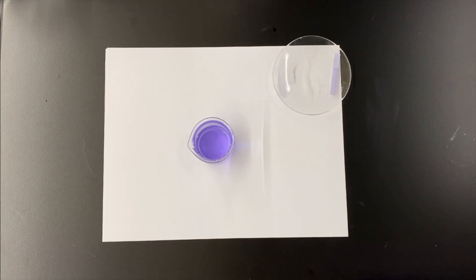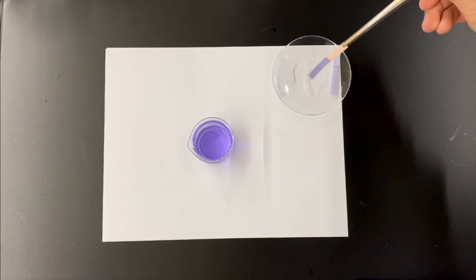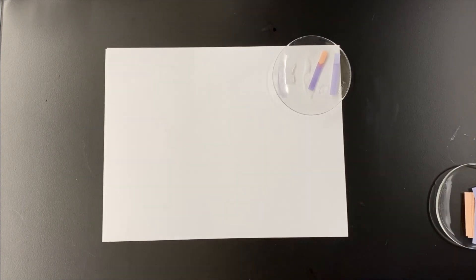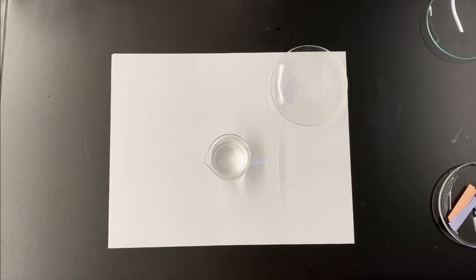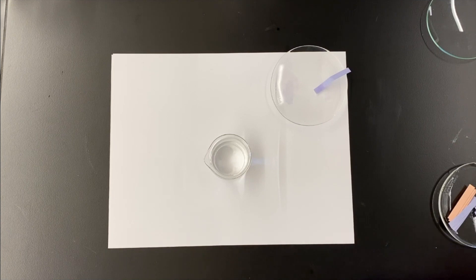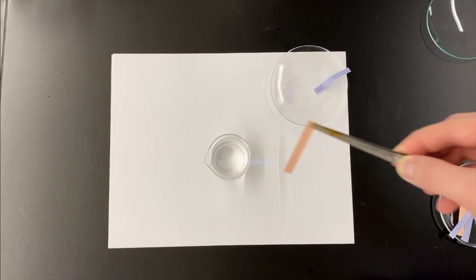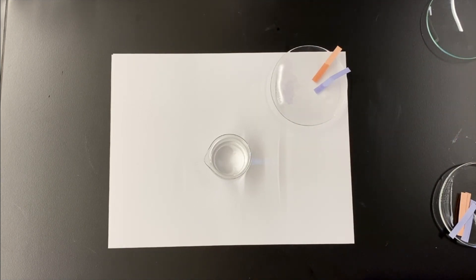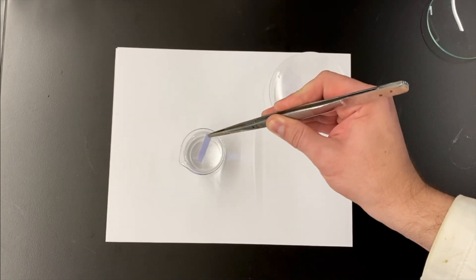For window cleaner, we have the red litmus turning clear to blue, indicating a basic solution. Up next we have our 0.1 molar sodium chloride solution — you might know this as salt water. No change there — red stays red, blue stays blue. So strong electrolytes, at least these strong electrolytes, don't affect the pH of the solution.